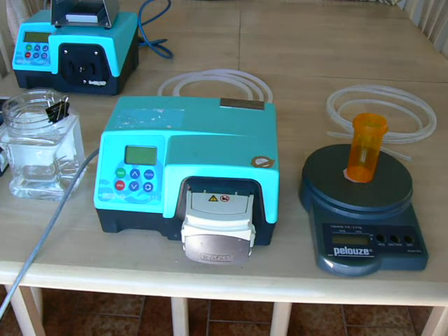In this video, we're going to review the Watson-Marlow 323 pump and discuss how to operate it, how to select tubing, how to adjust the pump head, how to load tubing, how to set the memo dose, and how to add additional pump heads.